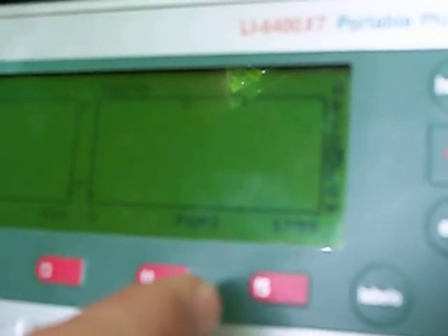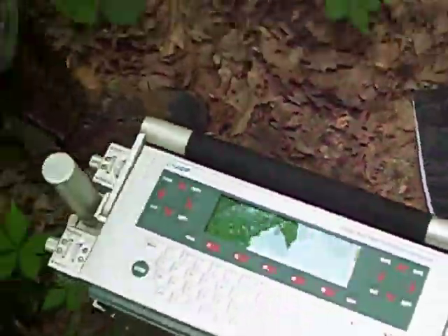And the actual result. This is, I don't know if you can see it, a light curve being formed. Basically, a light curve is kind of like a half a hyperbola. There'll be a portion at very high light levels where photosynthesis is what we call saturated by light. Then as the light intensity drops, so will the photosynthetic rate, and you get a curvature for the photosynthetic rate, which is a light curve.